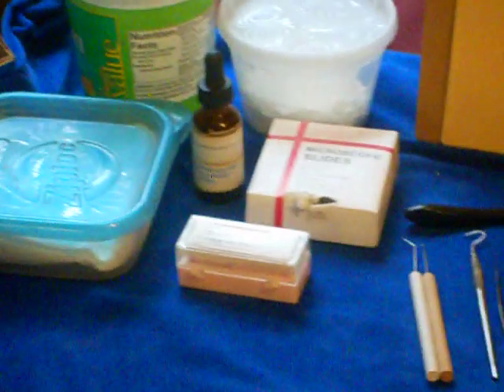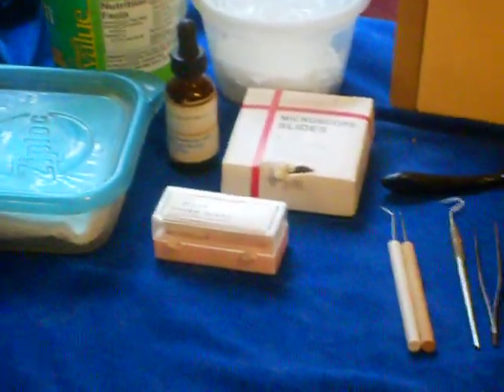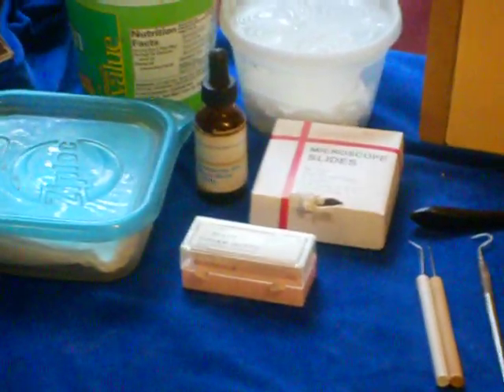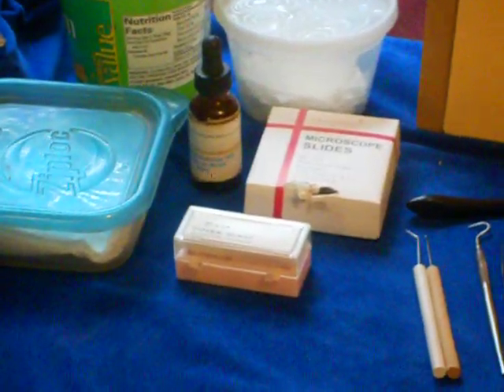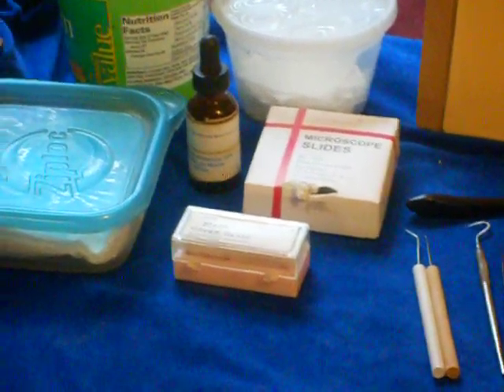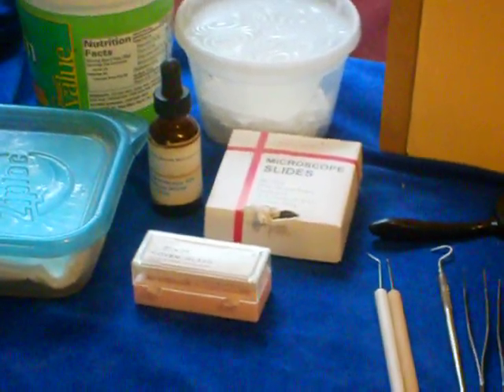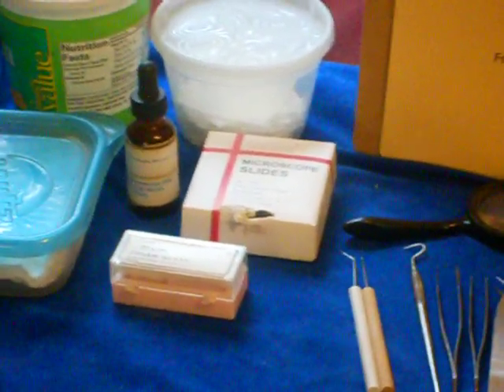And then let's focus on the two things you'll need for your microscope that I suggest that you absolutely need. In front is a box of cover slips. They're 22 by 22 millimeters in size, but you want to get number 2. You want to get the thick ones. That's very important because those can be washed and reused, and they don't break when you put samples into them. In back of that, a box of microscope slides.